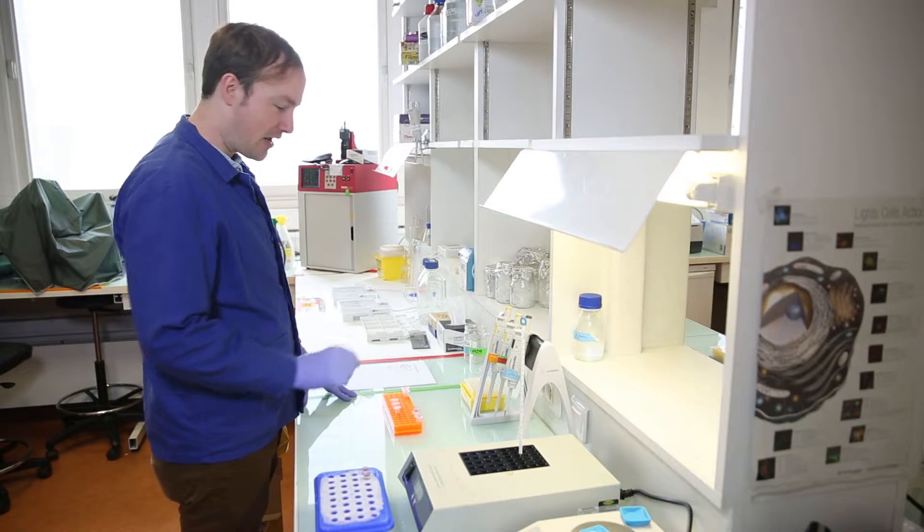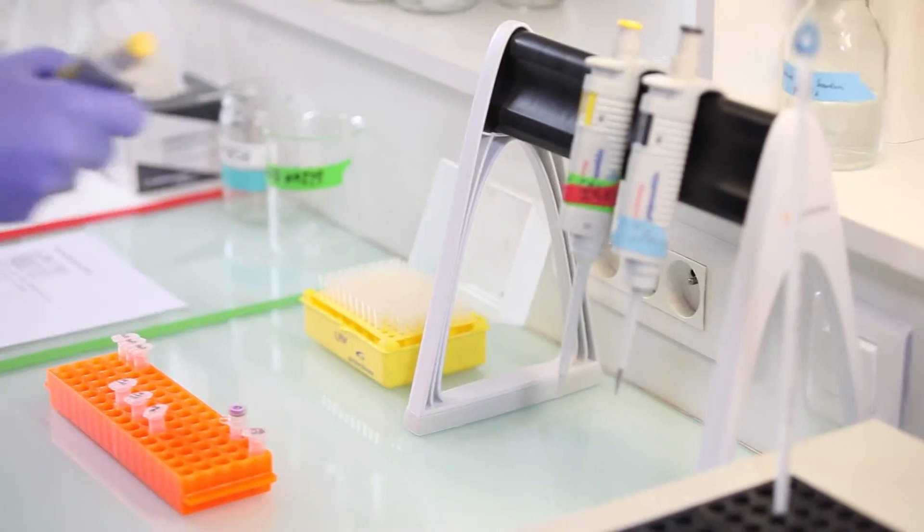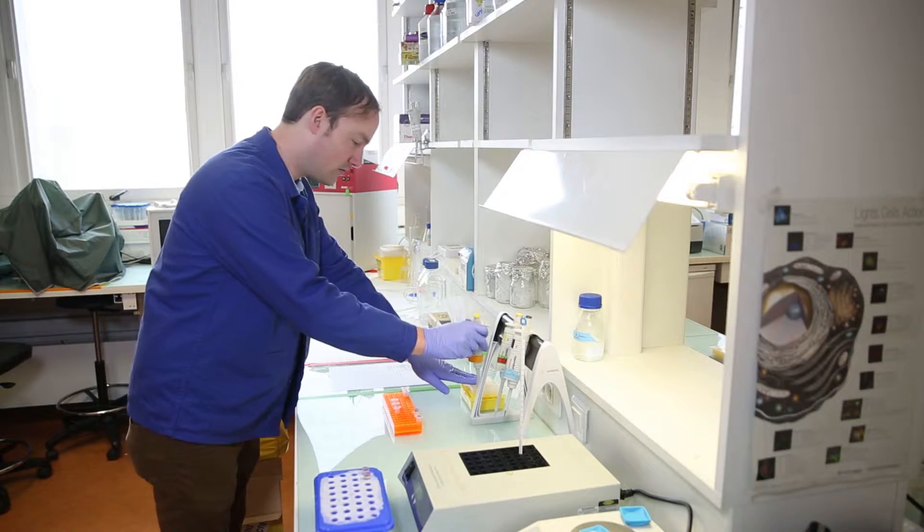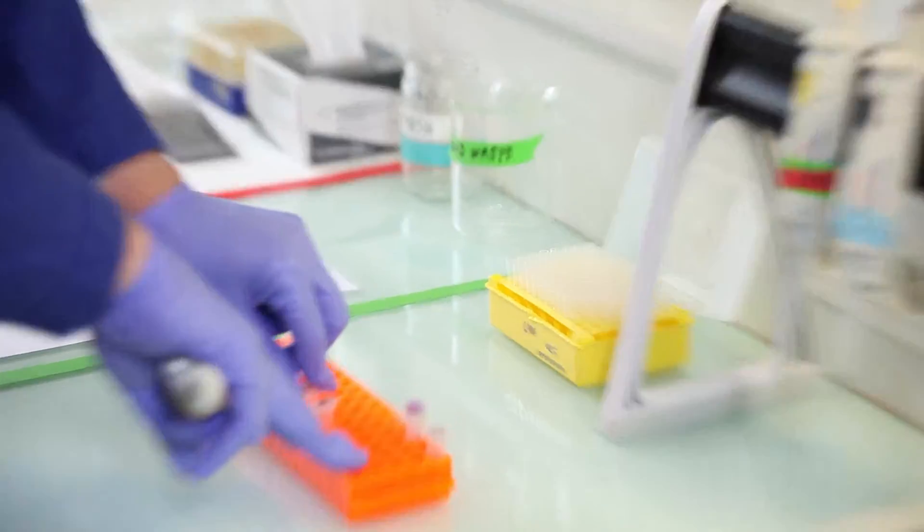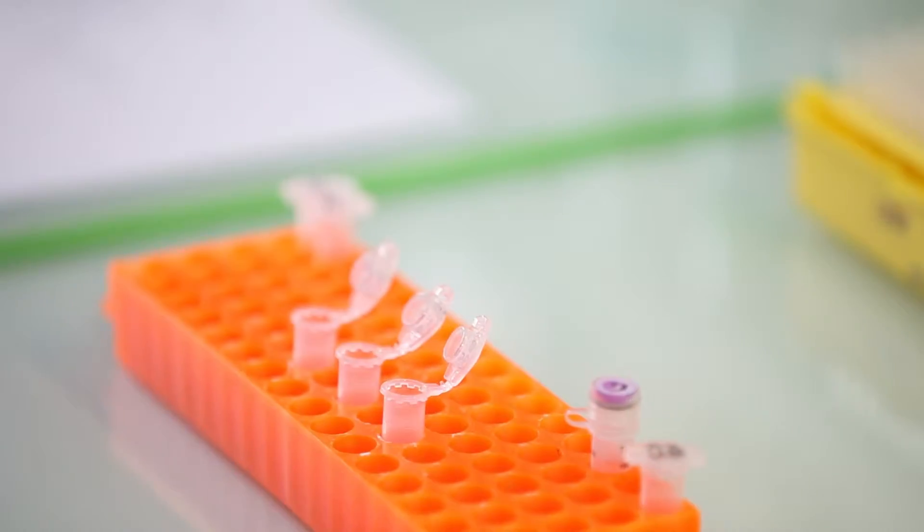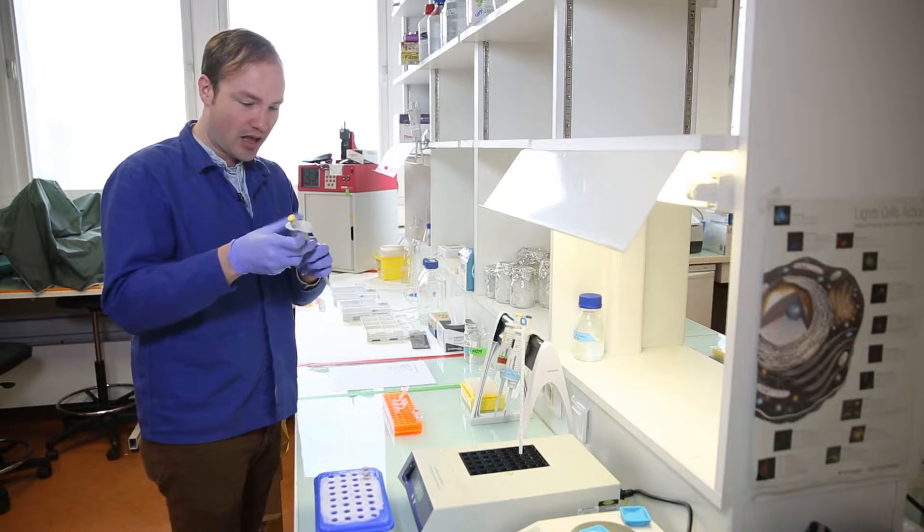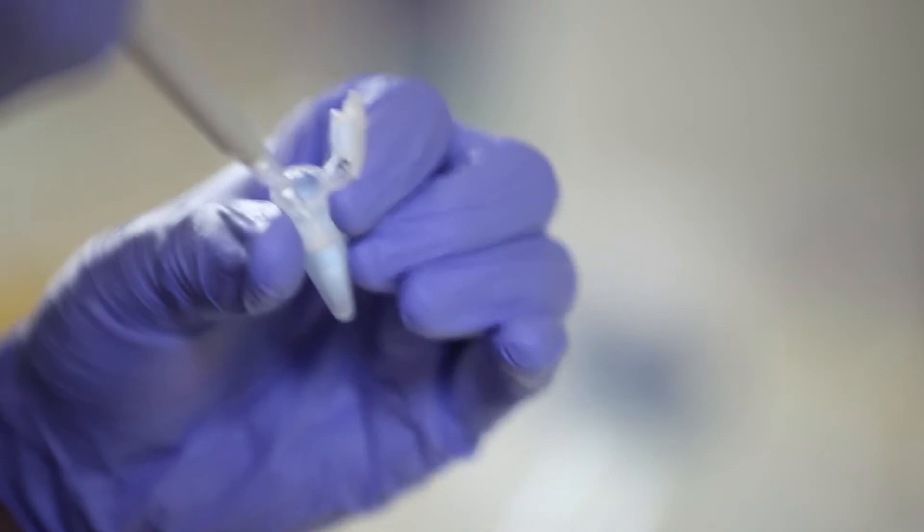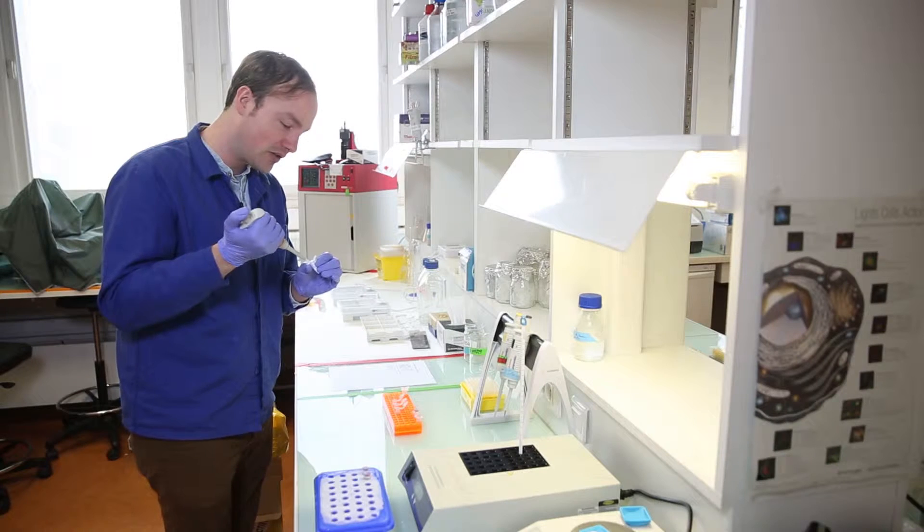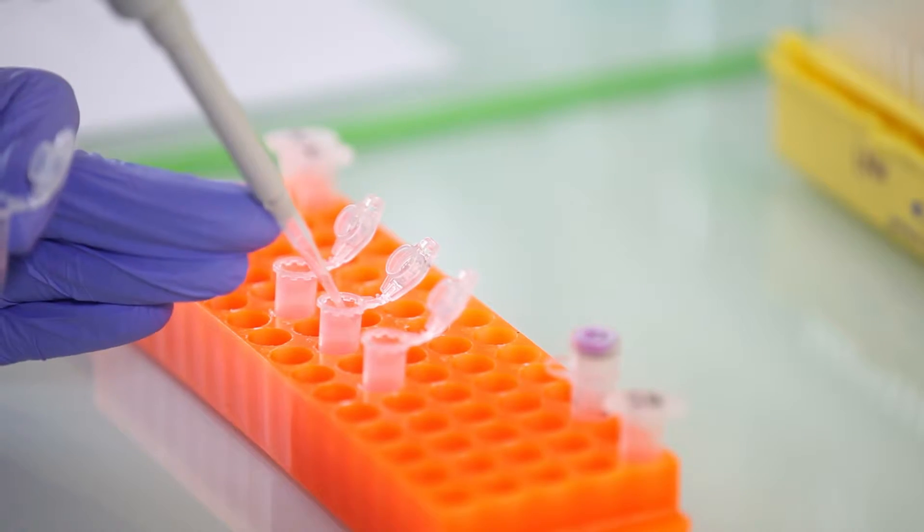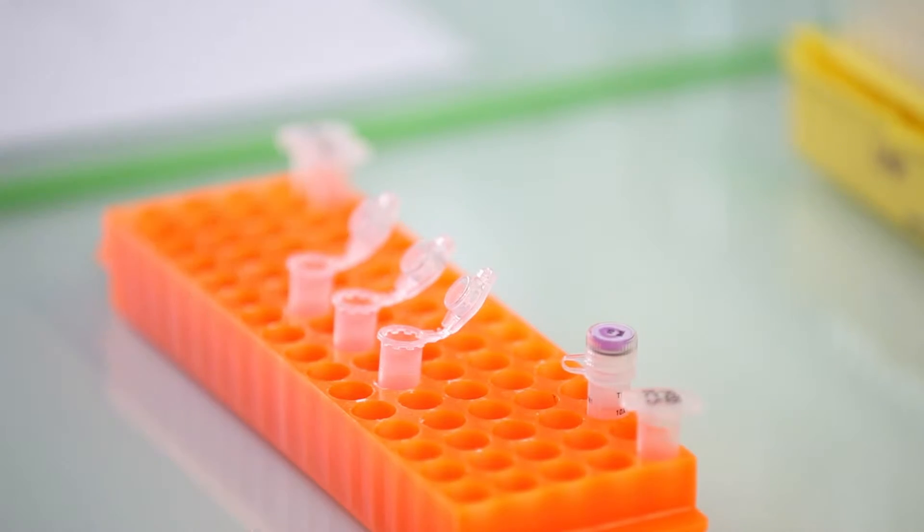We'll be preparing three reactions today, and the first thing I want to add is the water. I'll be adding 72 microliters of water because we plan on a total reaction volume of 100 microliters. This is a slightly larger reaction volume than I would normally use, but I wanted to do a nice big reaction because I thought it would look better on camera, and this also gives us extra plasmid material to work with.